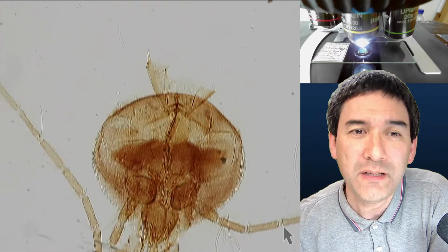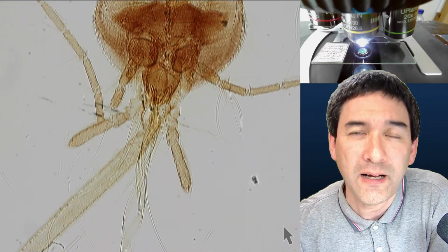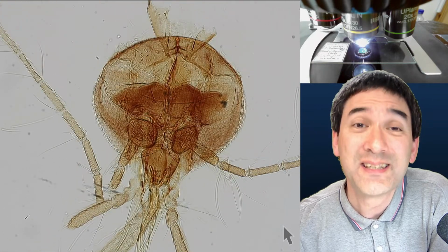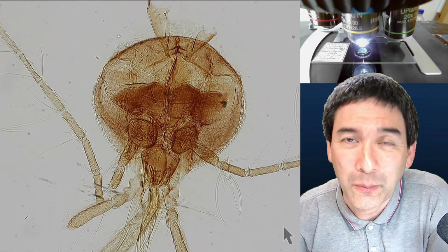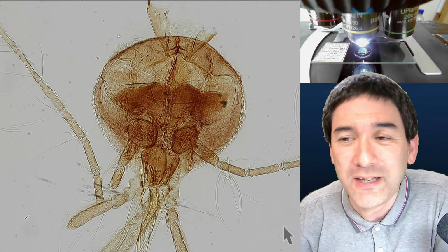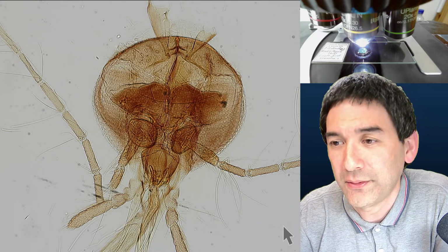But still, even if you move slowly, I sometimes found that it's still faster than trying to take overlapping pictures. So for all practical purposes, I think video is more practical. But you can try it out.